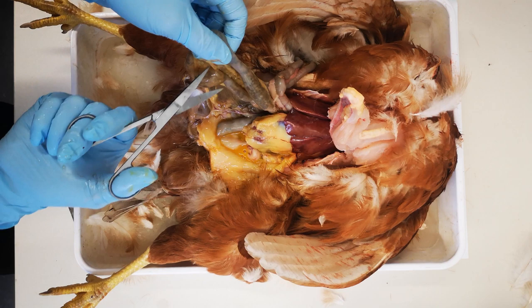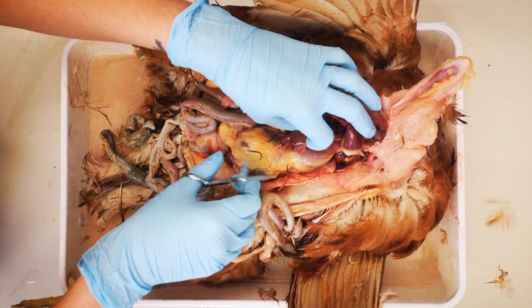The individual organs, especially those of the digestive tract, can now be separated from one another by detaching the mesenteries. These organs can be separated and removed for a further detailed examination. To do this, carefully cut off the supplying vessels of the organs with scissors and loosen the mesenteries.